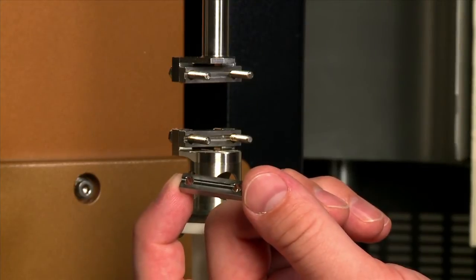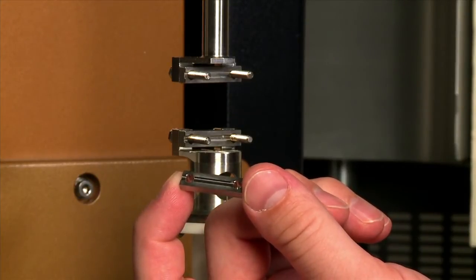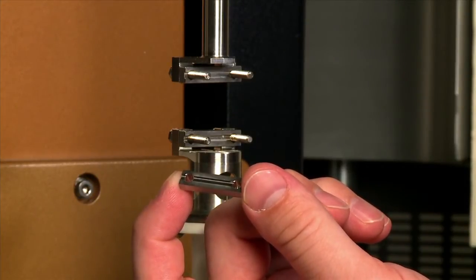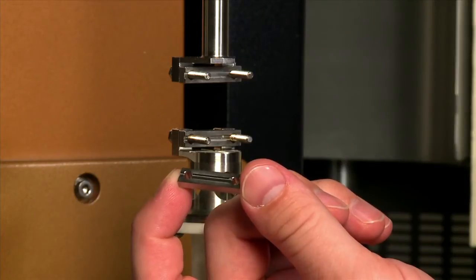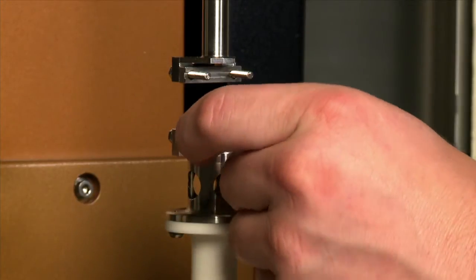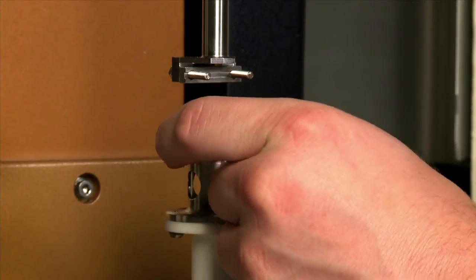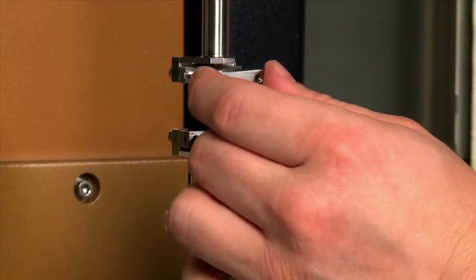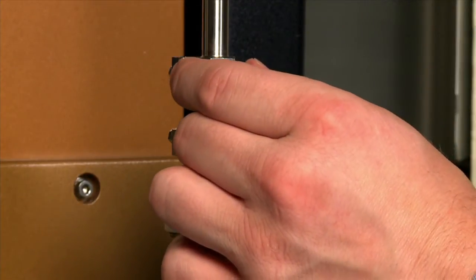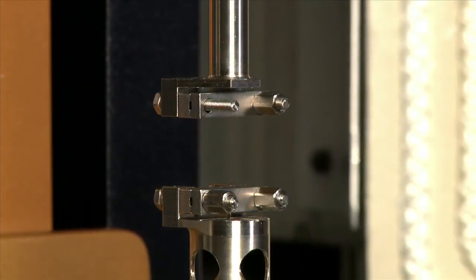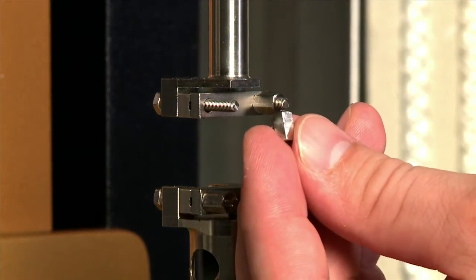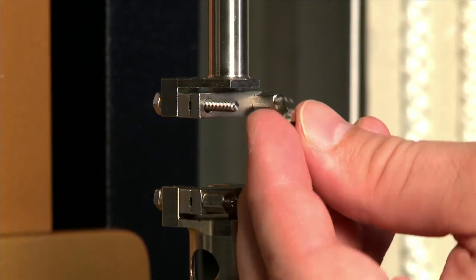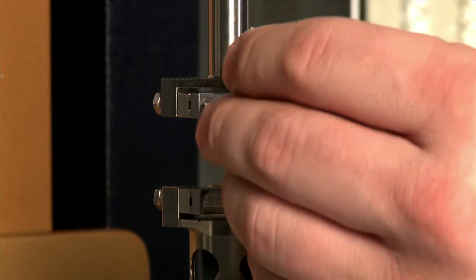The 3.5mm spacer will always be used on the front side of the sample, so with the groove side facing in, place on both geometries. Now that all the spacers are mounted, just finger tighten all four hexagonal fasteners.